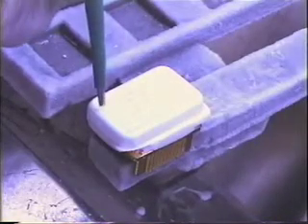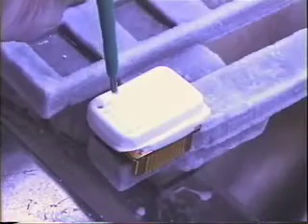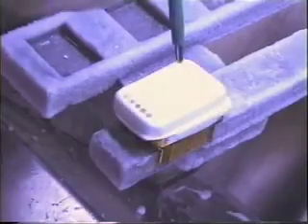Lift the stylet before punching. To insert, simply set the needle over the proper hole and push the stylet down. The tissue will fill the designated hole.